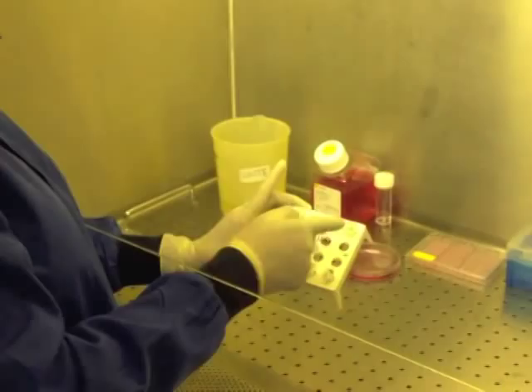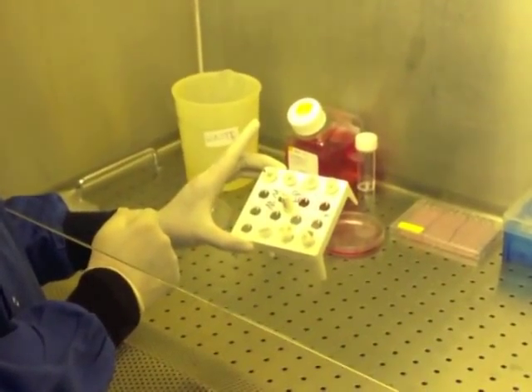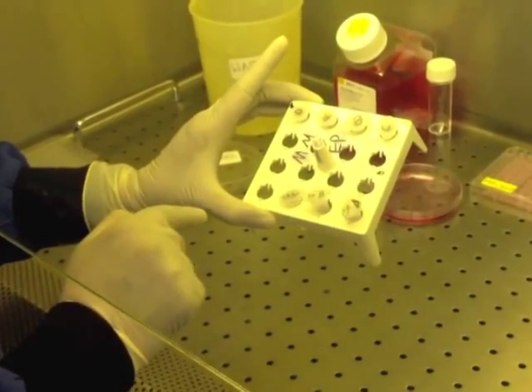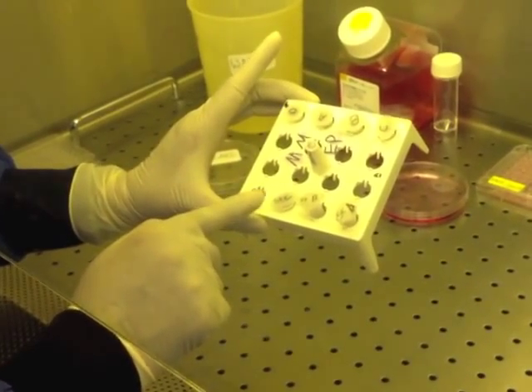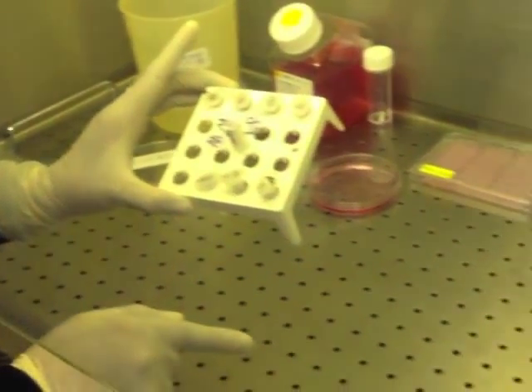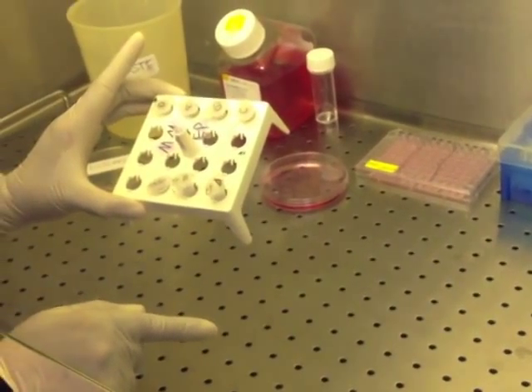Previously we saw how you label your four microfuge tubes. You should have stock solutions of your drugs supplied to you. It would be either in the incubator or out here in the cabinet itself provided for you.